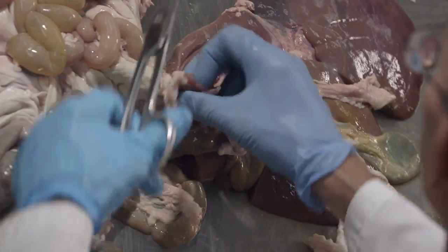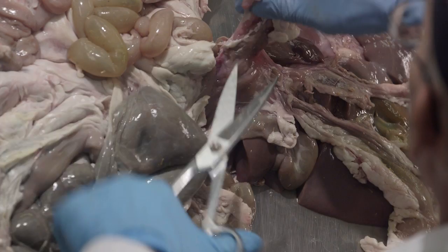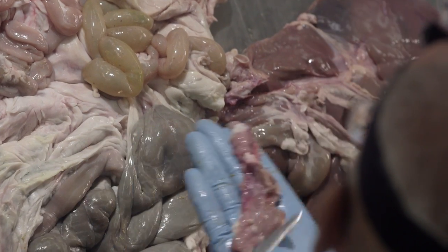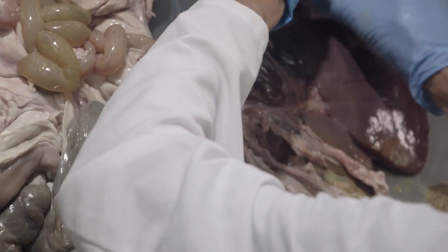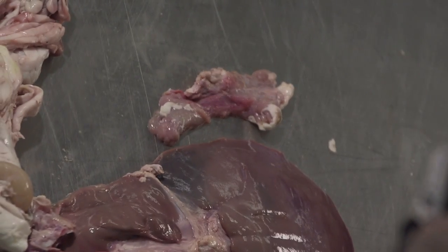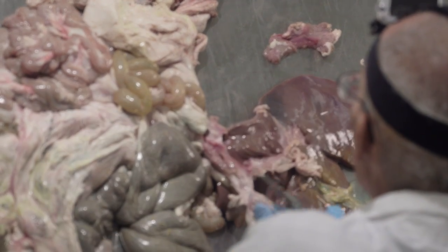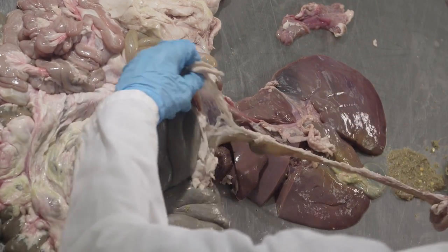Okay. Just as we saw in the pig, the pancreas is embedded in the tissue that surrounds the duodenum. So here you see pancreatic tissue. Just kind of lay that out there. But that very diffuse stuff, that's the pancreas, and it will also be depositing enzymes here to facilitate digestion in the upper part of the small intestine.